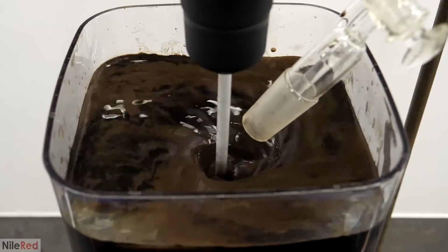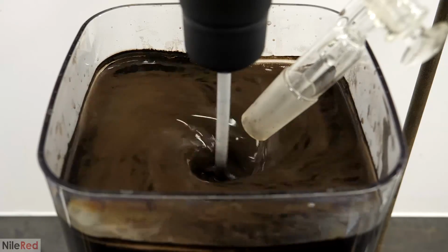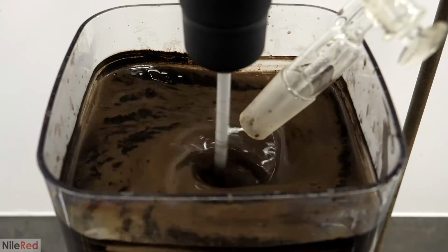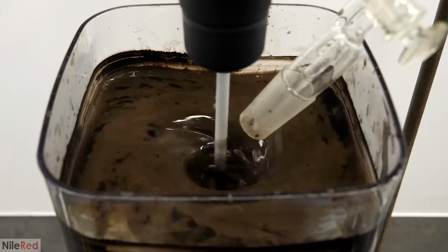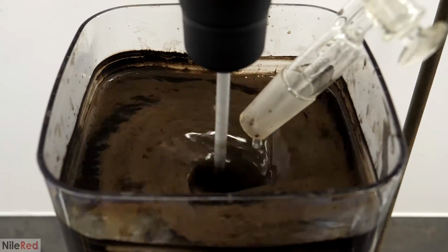I also occasionally refilled the funnel with more 10% acid because it needed more than I could initially fit in it. When it did get close to being done, a lot of the soap foam had disappeared and the coated magnetite particles started separating from the water.